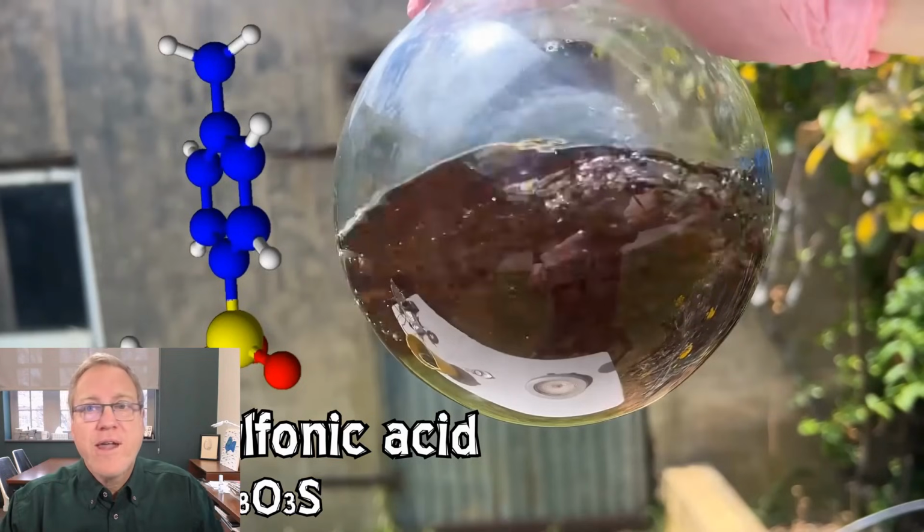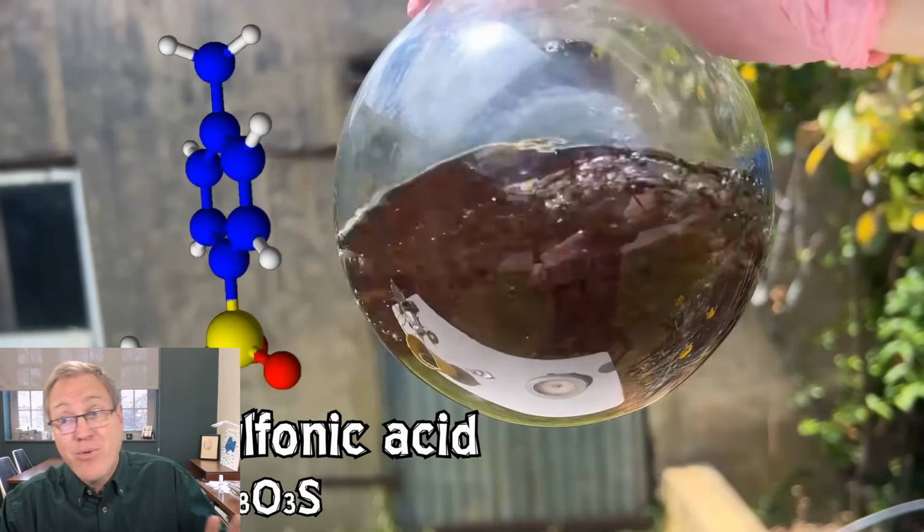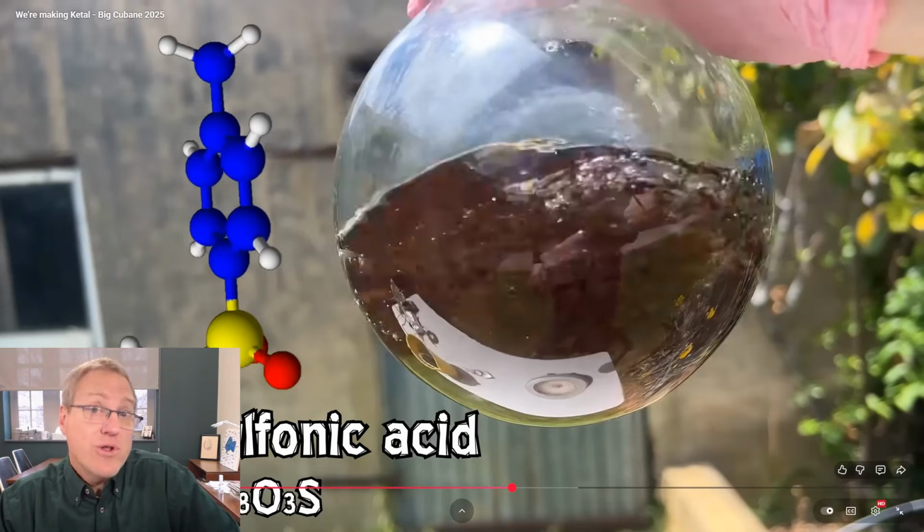So toluene sulfonic acid, you can form toluene sulfonic acid by heating toluene with sulfuric acid, which is exactly what he did. He just did an electrophilic aromatic substitution. So this is completely chemically reasonable, but I would not have expected it.